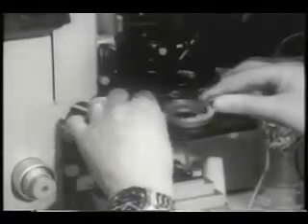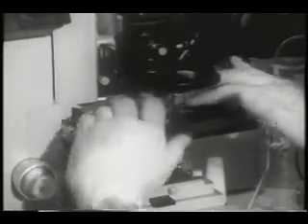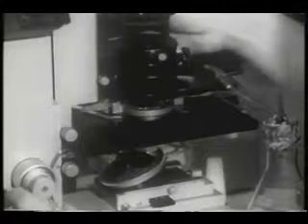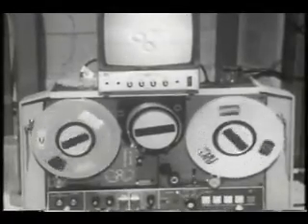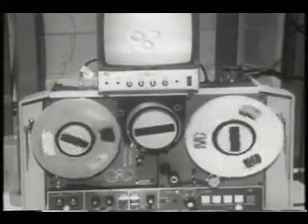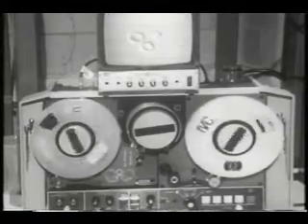The chamber is placed on the stage of an inverted microscope equipped with differential interference optics and observed with a 100x oil immersion objective. The microscope image is relayed into a low light level video camera. The resulting video signal is processed with image-enhancing electronics and recorded on videotape. Selected sequences were transferred to 16mm motion picture film by electron beam recording. All of the sequences depicted in this film are presented in real time.